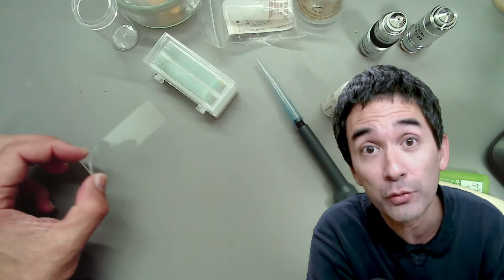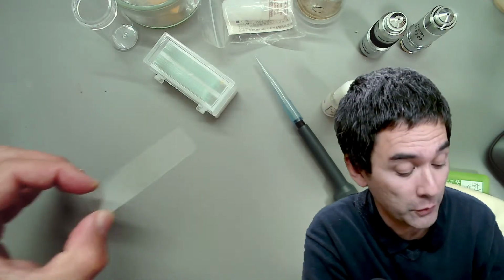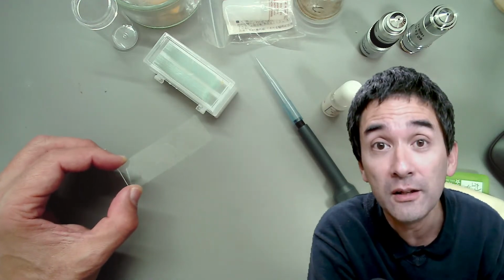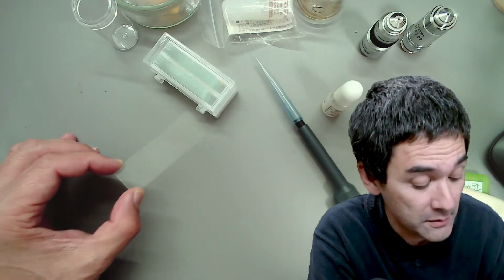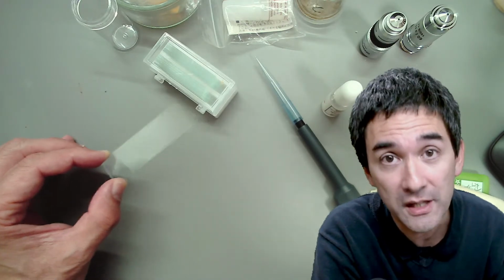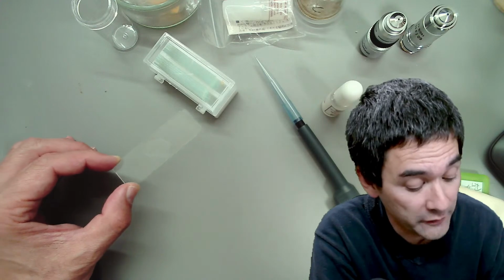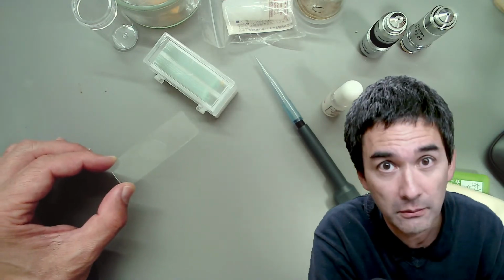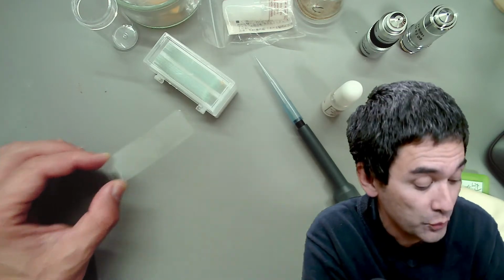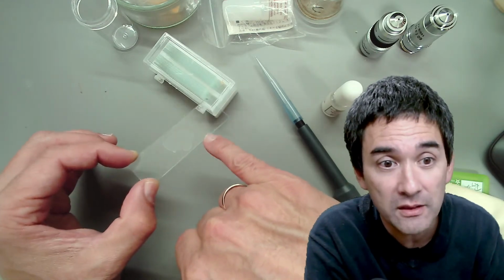I've not done it with a dried blood smear, but I've got here a yeast suspension, and I'm going to show you how to heat fix the slide. This process is called heat fixing, and is actually quite common. I would say for observing in oil immersion it's probably more common than actually using a cover glass. The reason is because you get a very thin film.